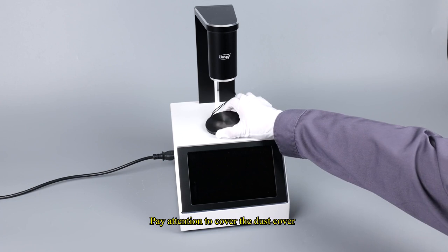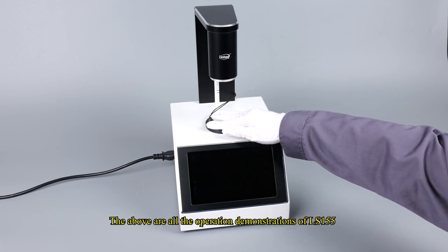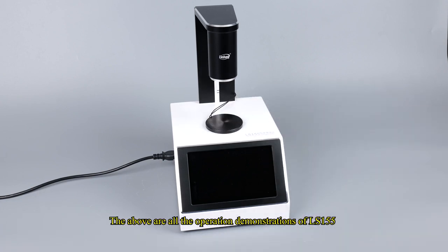Pay attention to cover the dust cover. The above are all the operation demonstrations of LS155.